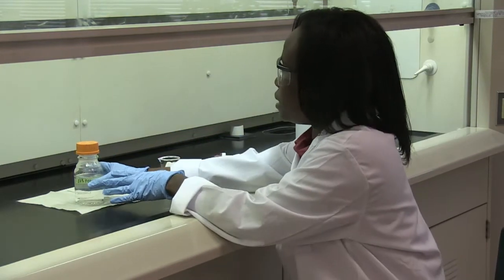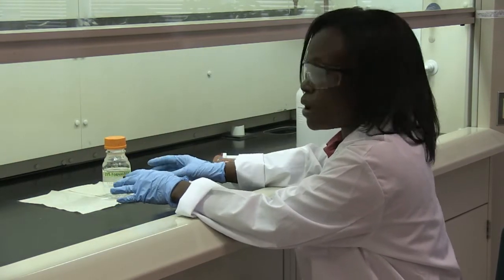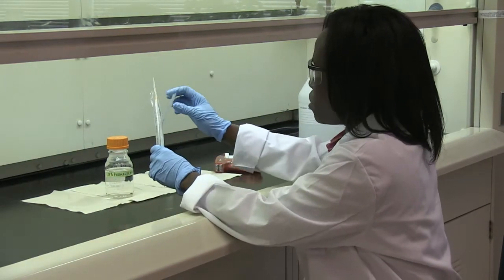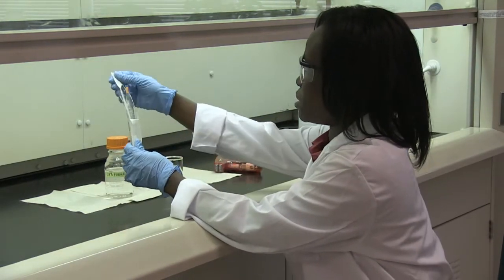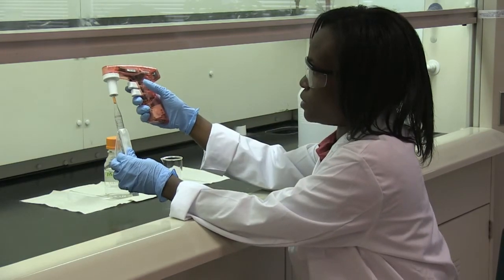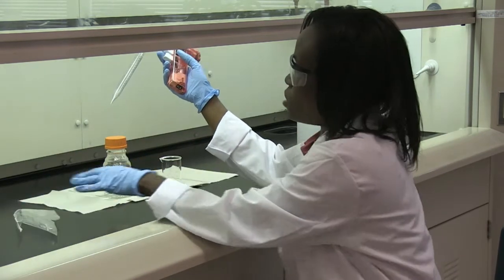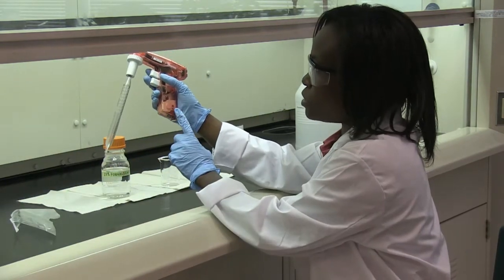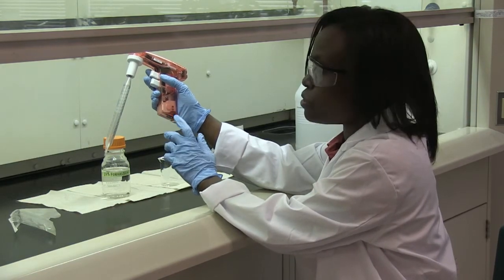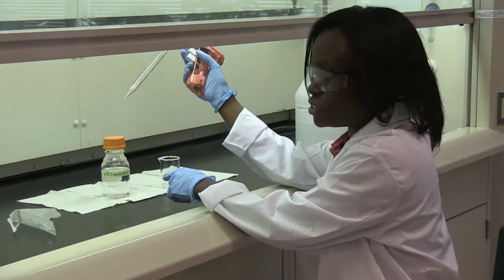When handling chemicals in general, handle them with care to avoid spills. I'm going to show you an example of how to handle a chemical using a pipeter with a serological pipet — this one is an automatic pipeter. Note that I'm using a pipeter and not pipeting by mouth. Under no circumstances should you pipet by mouth, because these chemicals are dangerous.